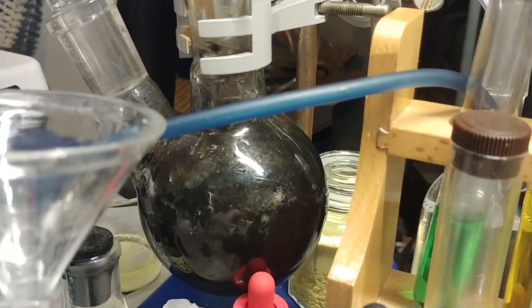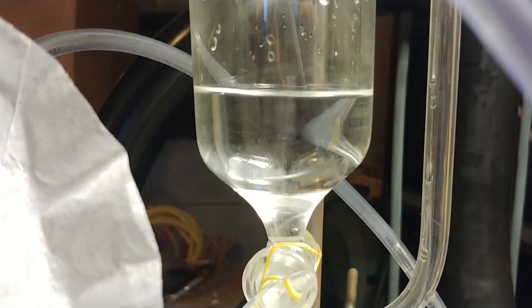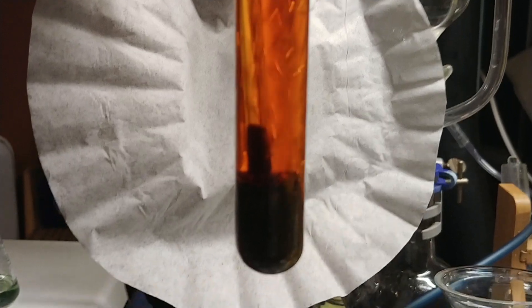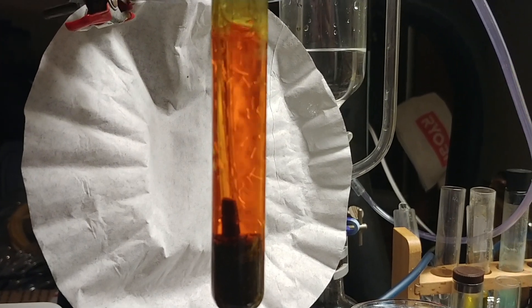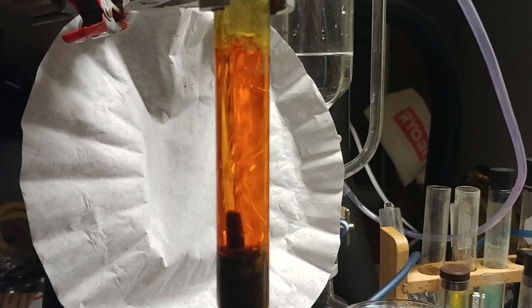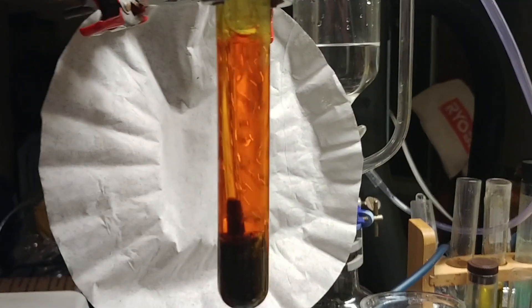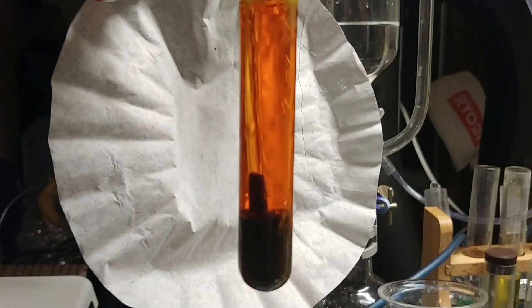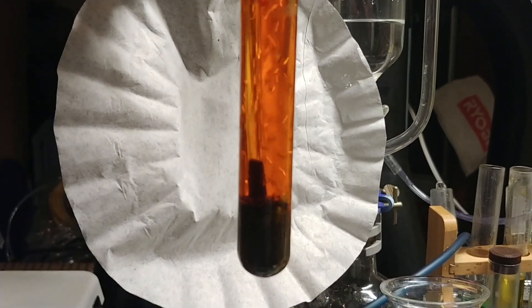For now I've got manganese dioxide here and hydrogen peroxide — it's about a 12% solution. As it drips it creates a nice steady stream of O2, and this should hopefully work a little bit better. It might also control the acidity since it's pure O2 rather than a mixture of air, where small amounts of carbon dioxide can slightly acidify the solution.